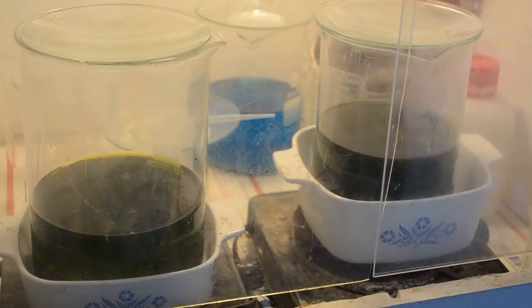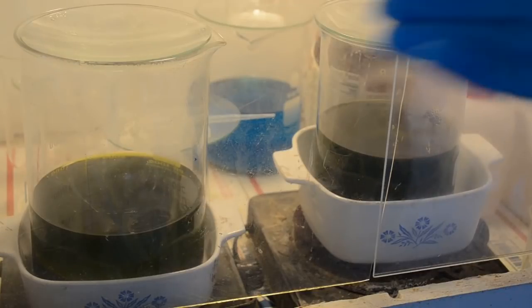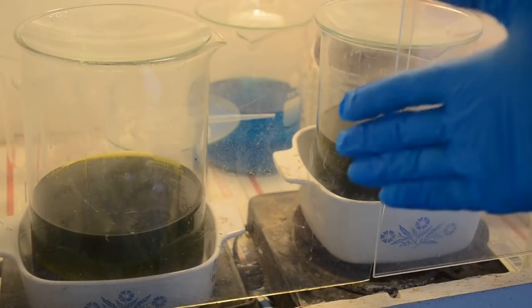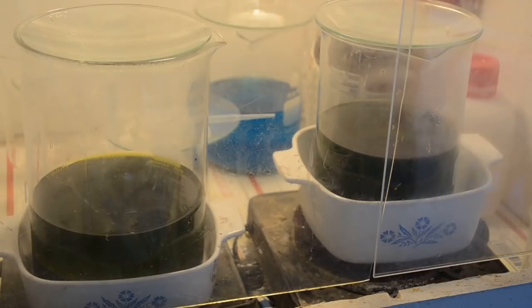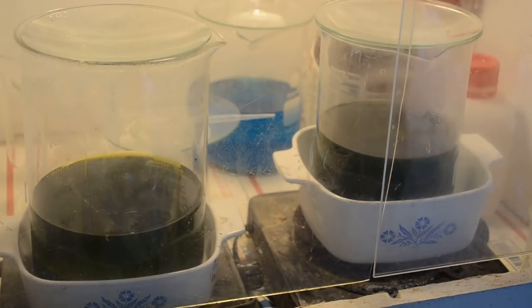This stuff has just been sitting here. I've added a little bit more nitric acid to it and I've turned the heat up, and we'll see if we get any kind of reaction. I'm thinking probably by now all the metals are in solution, but hey, I've thought that before and been wrong. So a little bit more nitric acid, we'll give it some heat, see if we get a reaction. If not, I'll denox it and we'll filter off this liquid and drop some more gold, and then we'll move on to the next batch.